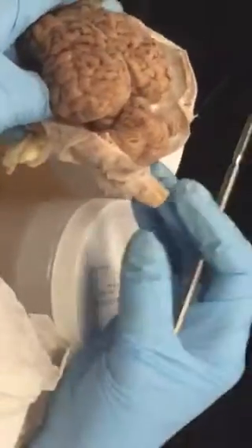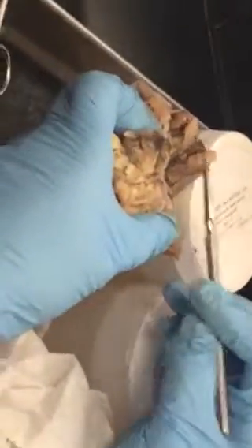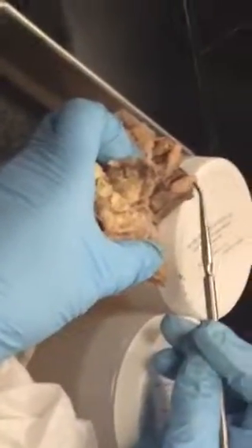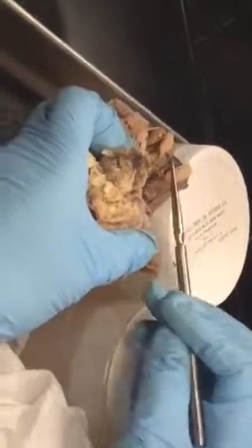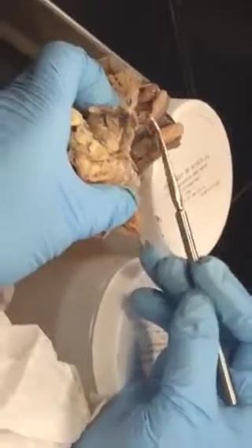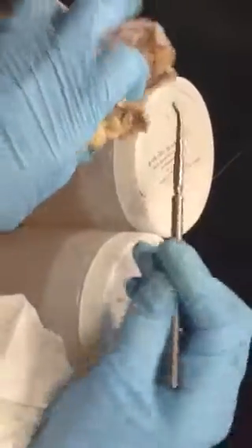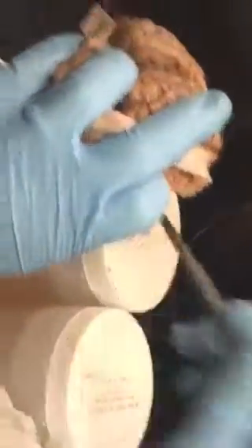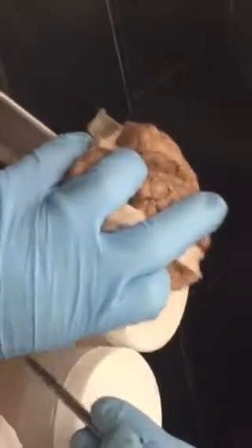Okay. Now, if I cut it sagittally, you will see what you see in your lab manual. Again, your lab manual has all the diagrams, right? Now let me show you again. What are these little things? You have studied this on the brain model. Olfactory nerve, bulb, and tract. These are technically bulbs. After that is the tract. But on this sheep brain, you cannot easily see it. The nerves are already broken off. The nerves go from the bulb down to the nasal cavity. Does it make sense?